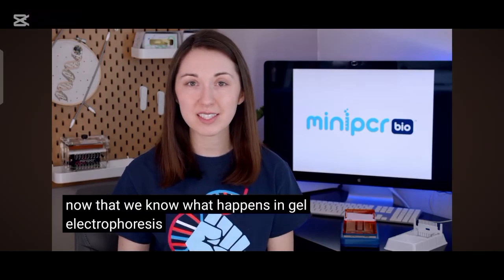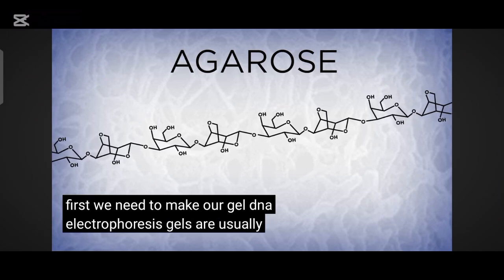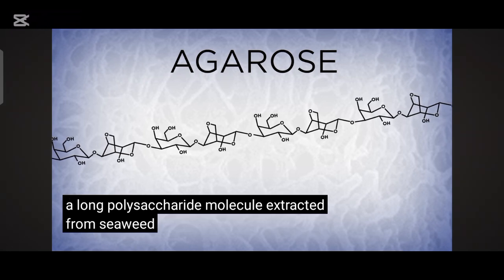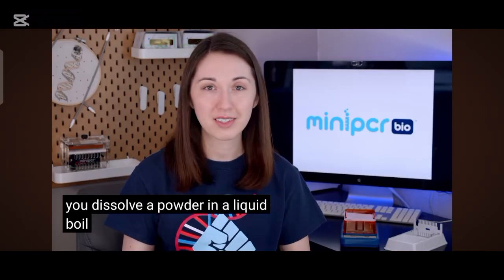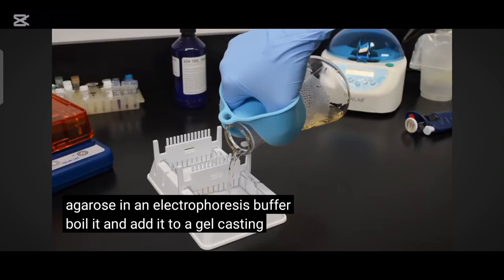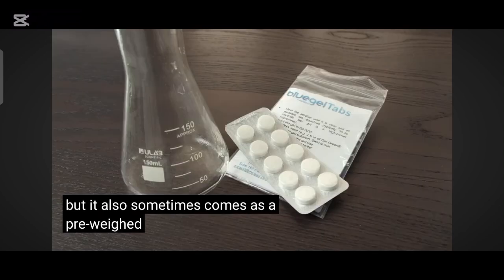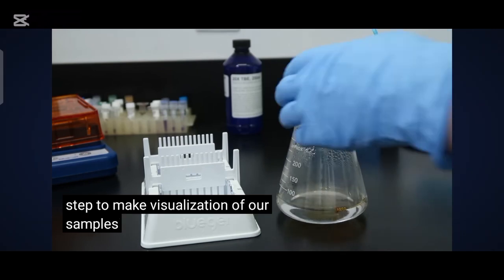Now that we know what happens in gel electrophoresis, let's talk about how we actually perform this technique in the lab. First, we need to make our gel. DNA electrophoresis gels are usually made from agarose, a long polysaccharide molecule extracted from seaweed. Making a gel is a bit like making jello: you dissolve a powder in a liquid, boil it, and allow it to cool and thicken in a mold. To create an agarose gel, we dissolve agarose in an electrophoresis buffer, boil it, and add it to a gel casting tray. Agarose typically comes as a powder, but sometimes as a pre-weighed tablet. We usually also add a DNA stain at this step to make visualization easier later on.